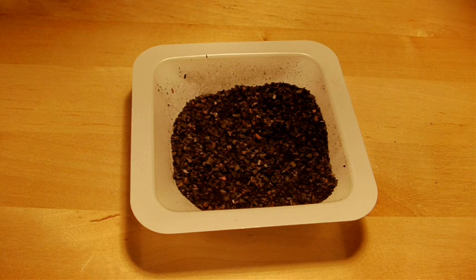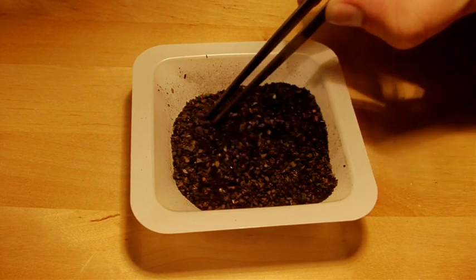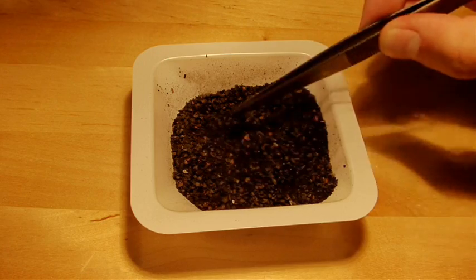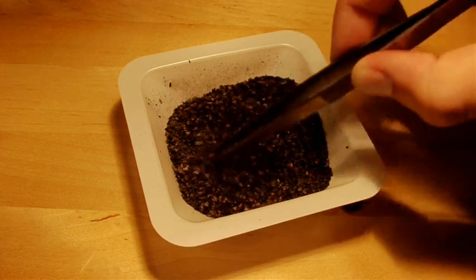Here are the final products of the reaction — it's not quite what I was hoping for. I thought it was going to turn into basically a molten puddle of copper metal, but it appears some of these pieces have a brown color to them, which I imagine is the copper plated onto the outside of the remaining carbon pieces. Interestingly, I started with 16.7 grams of copper carbonate and 10.4 grams of carbon, giving 27.1 grams total. After the reaction, I have 19.6 grams of product, meaning I lost 7.5 grams — so 7.5 grams of mass escaped as carbon dioxide. It definitely did something, just not quite what I was hoping for. A little anticlimactic, but I hope you got the gist of it.